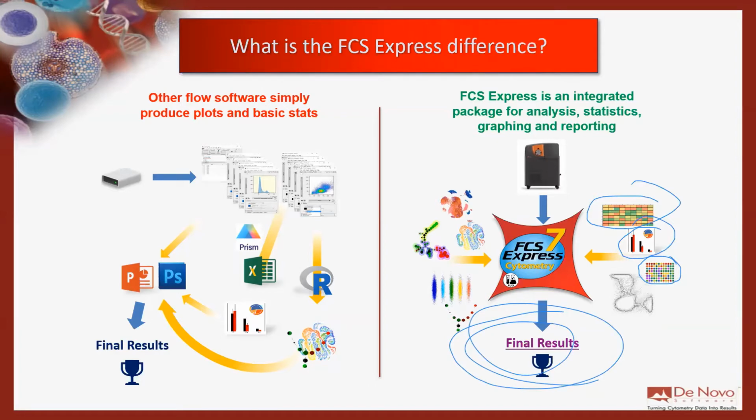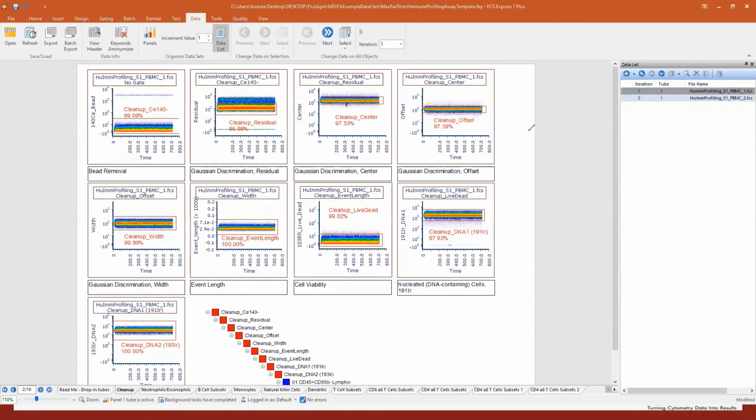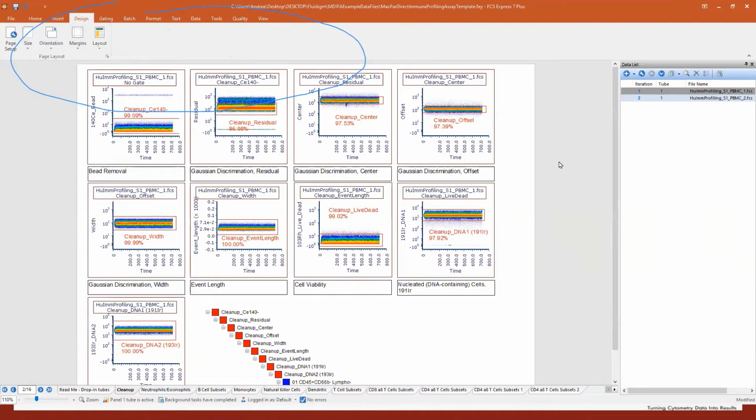So let me bring on the screen a layout from FCS Express. What you see here is not PowerPoint, it's FCS Express. We will see a little bit of the user interface in a second. It's similar to PowerPoint. You see we have a ribbon bar at the top. For example, if I go to the text, I can format the text that I have on my page. If I go to design, I can change the size and the orientation of my page. So what you see here is one page among many in my layout.